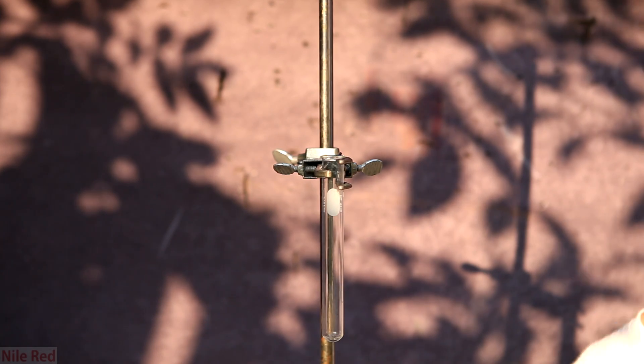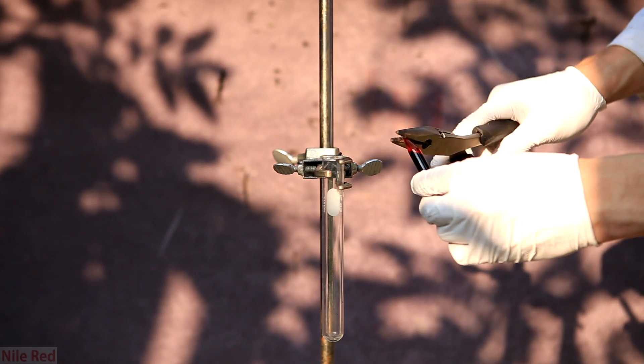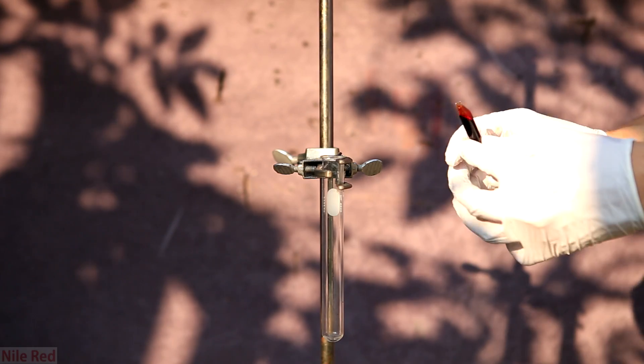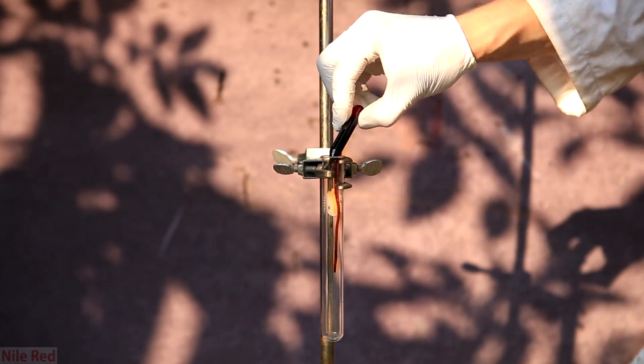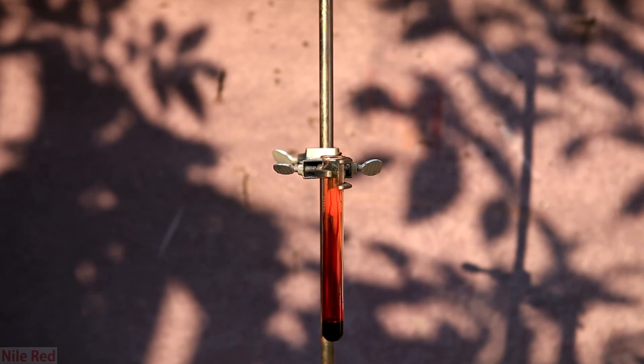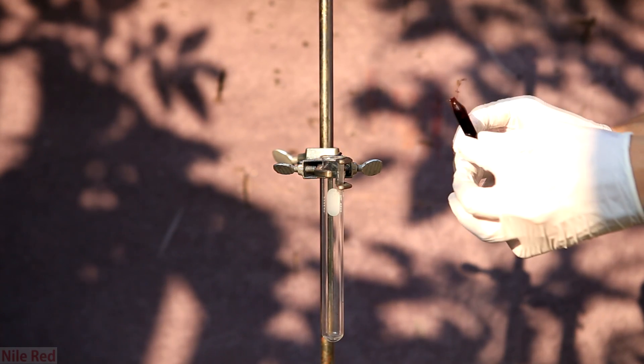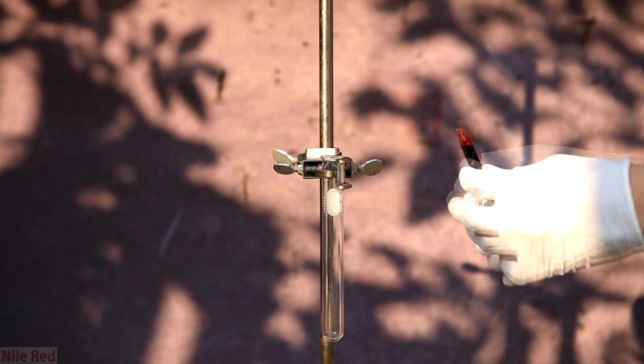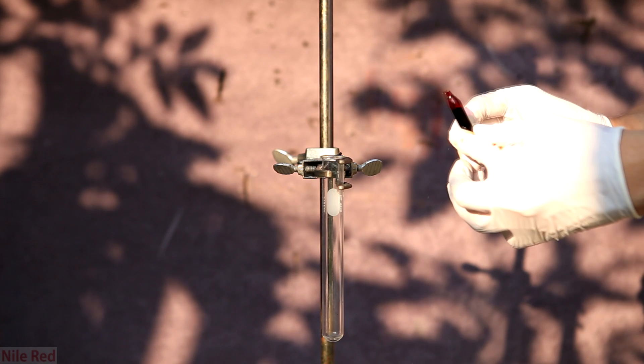I decided to do a second run. Also, when I crack the ampoule, you might notice that I actually get some of the bromine spilled onto my glove. I kept this part of the video in as a reminder that things do go wrong. However, because I was prepared and wearing gloves, I simply took them off as soon as possible and everything was fine.